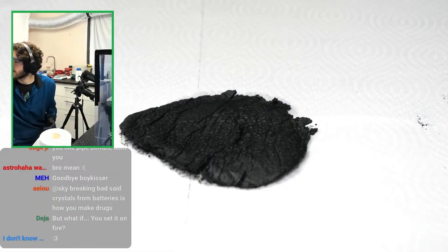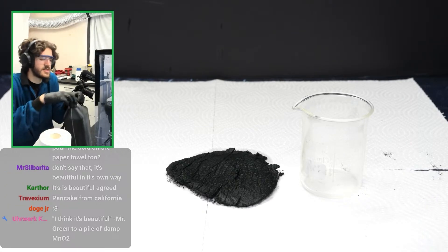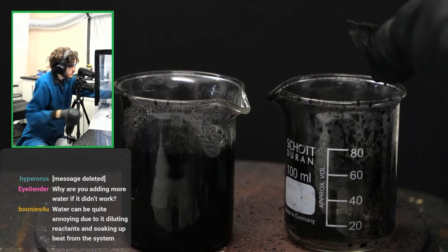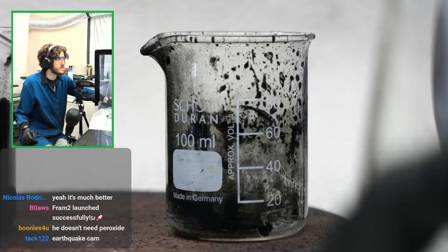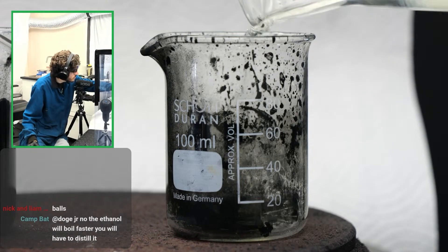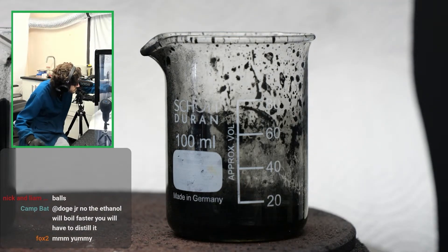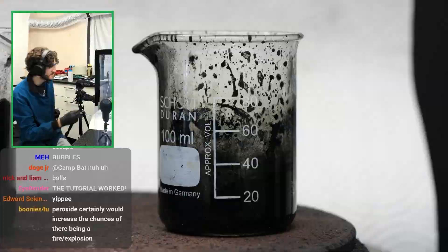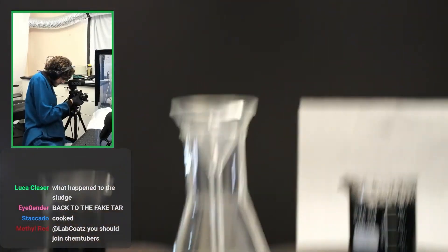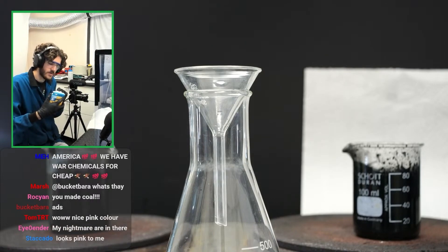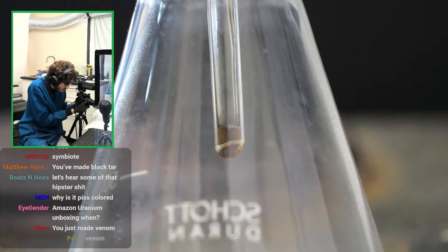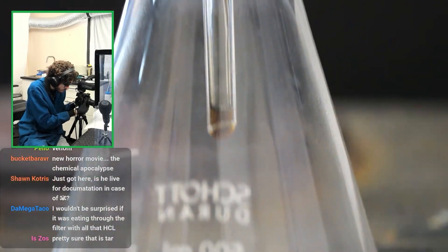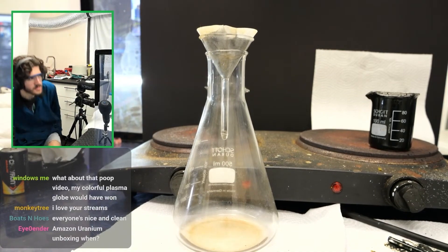Now, what was the next step? Add hydrochloric acid. I think I'm going to try that on a small scale first. Now, I'm going to try HCl first because I want to see what the solution looks like. So, let's do what the guy did. Add some manganese dioxide and we should be able to get this to react basically immediately. Here we go. Oh shit. It's actually doing something? Yes. That is chlorine. Let's add a filtering funnel thing right here and filter this liquid. And hopefully if I just add water, it will filter really quickly. Yeah, look at that. What is that? That is much darker than I would have expected. That's definitely got some impurities. That is not pink. We might need to try the sulfur dioxide method then.